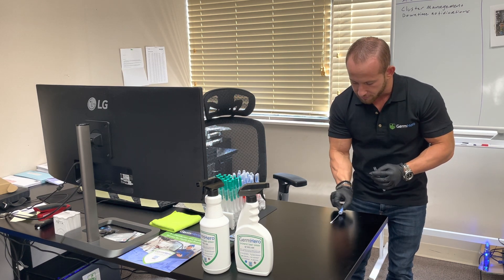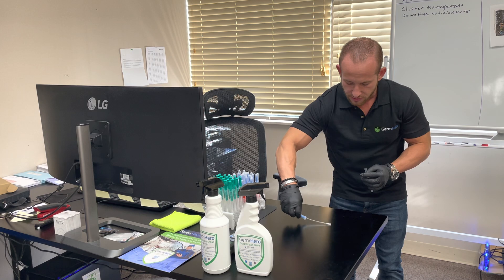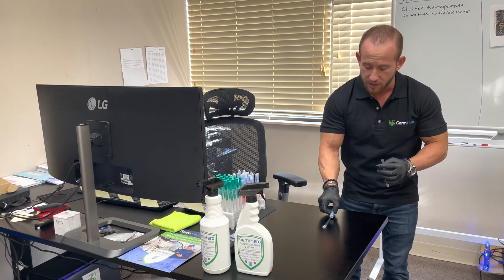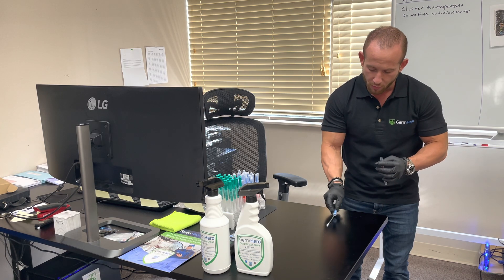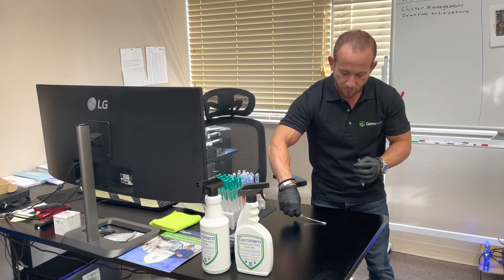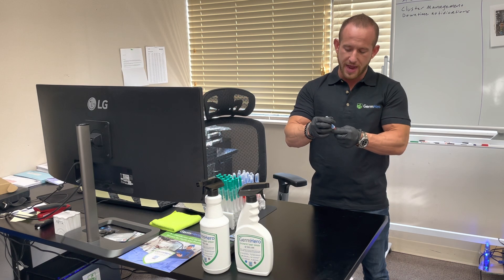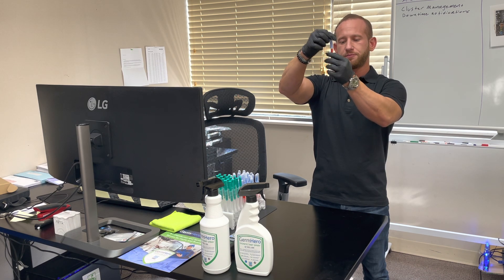I'm going to do a back-and-forth motion with the swab. This is really amazing technology for being able to understand how contaminated or how at risk you might be for certain bacteria, viruses, and other harmful microbials in your home or business. We work a lot with restaurants, food establishments, as well as medical facilities, to fully disinfect and ensure they're delivering the most sanitary facility possible to their customers and staff.